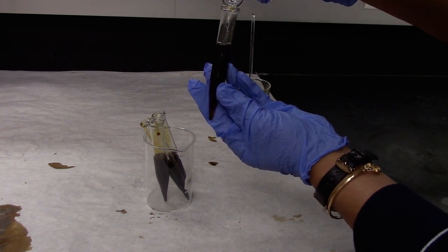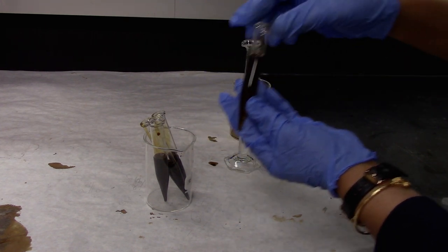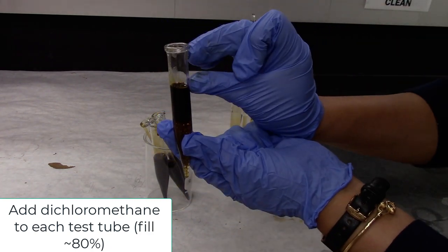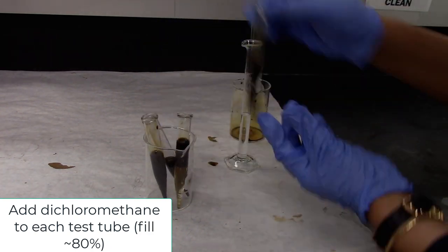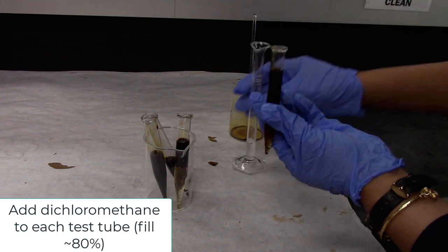Here I have around 10 ml of DCM. I'm going to fill these centrifuge tubes to about 80% with DCM.